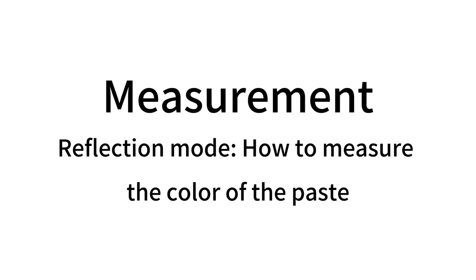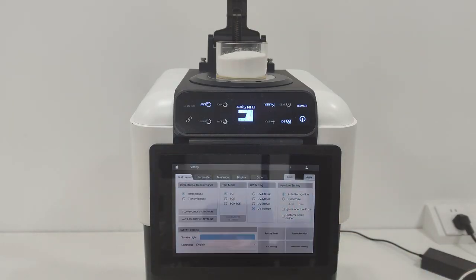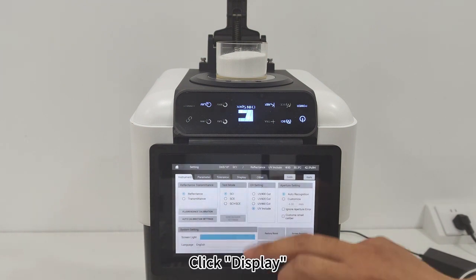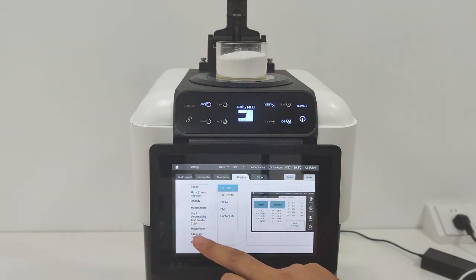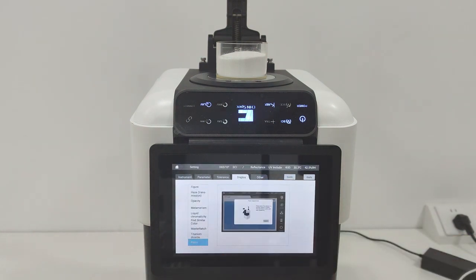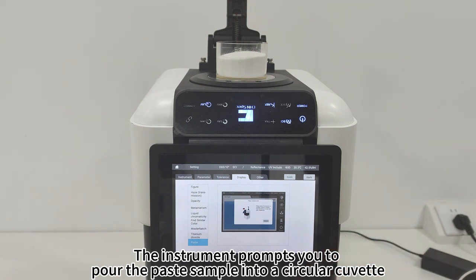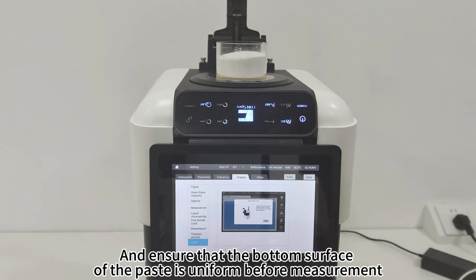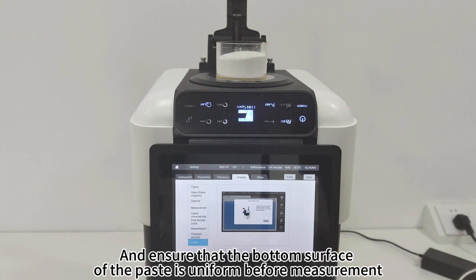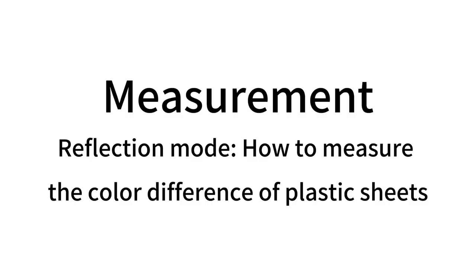Measurement — Reflection Mode. How to measure the color of paste: Click Settings, then click Display, and click on Paste. The instrument prompts you to pour the paste sample into a circular cuvette and ensure that the bottom surface of the paste is uniform before measurement.